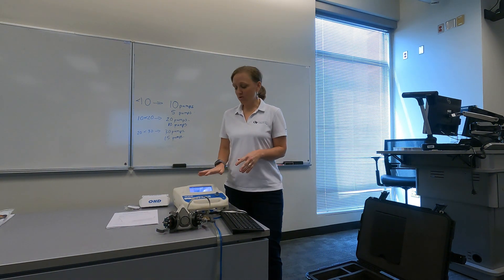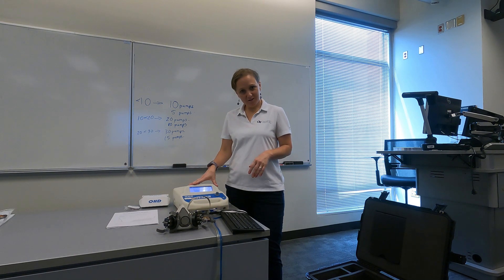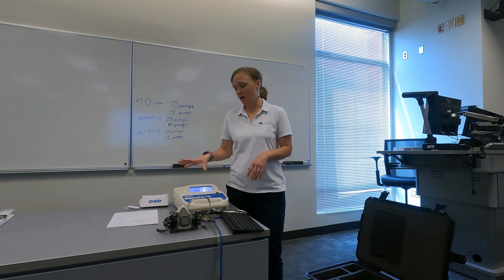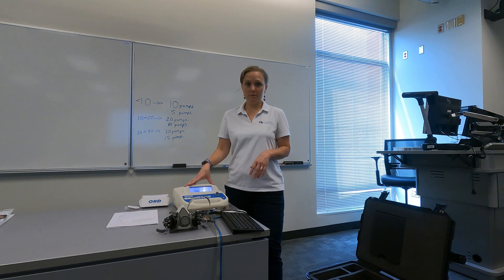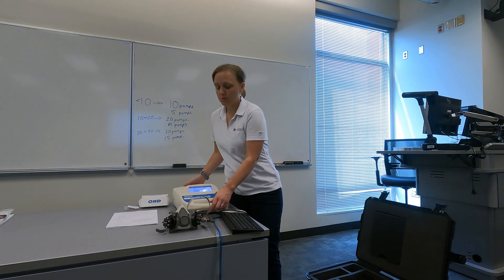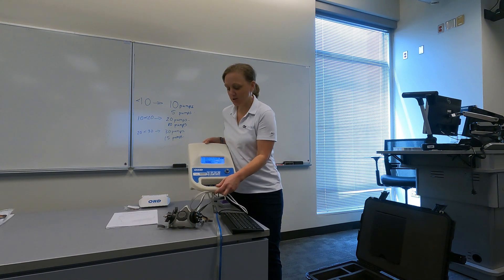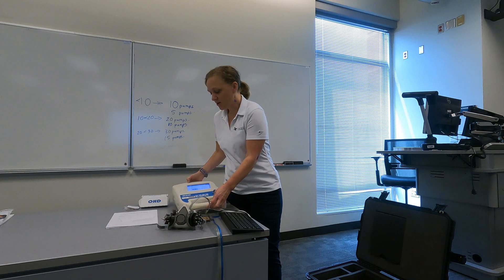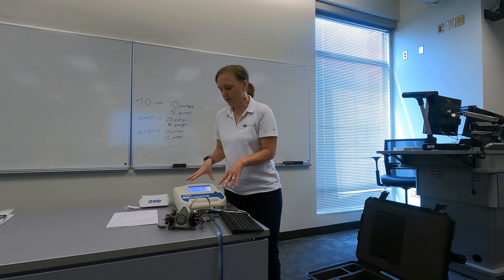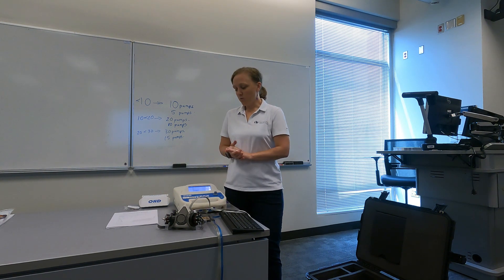Hi, my name is Jenny Holroyd and I'm going to show you how to do a quantitative fit test using an OHD quantifit machine. The machine we have looks like this. There is a newer model that looks a little bit different, but this is the one we have.